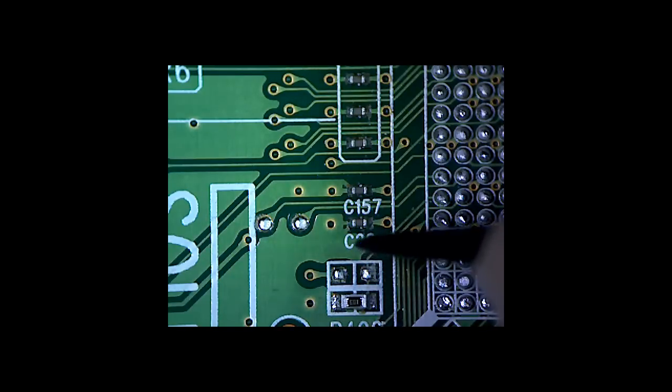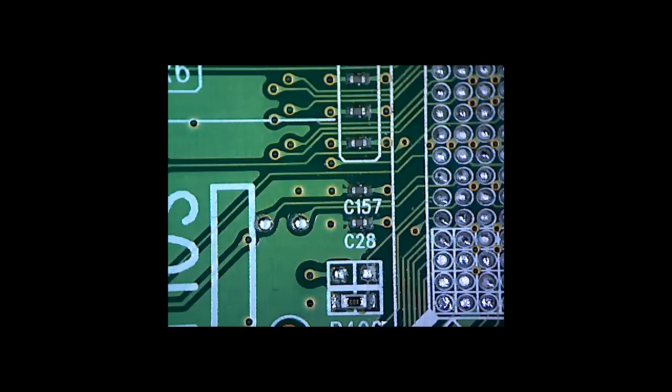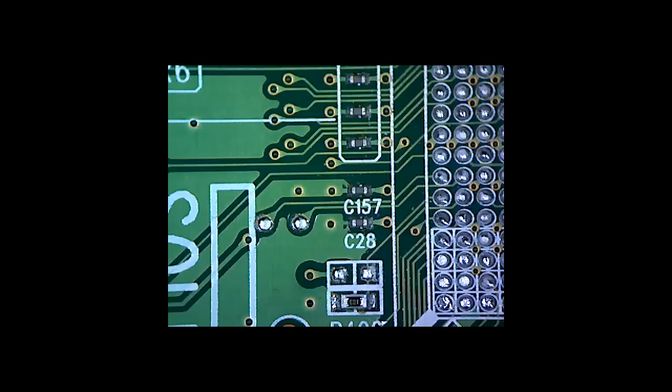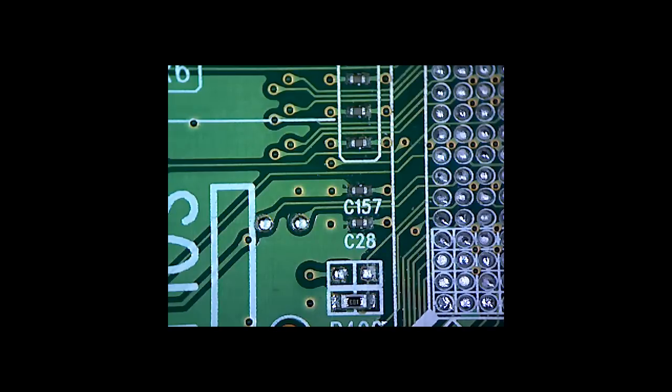The other thing to bear in mind is the image quality is very much dependent on your PC or laptop. The slower the performance, the lower the resolution that you'll capture at a reasonable frame rate. You can enlarge this to full screen but it's just all blocky and horrible if you do that, so don't even bother. When you click on the maximize and restore down button, top right next to the little white cross, it will automatically go down to the size of box that gives you a decent image quality. You can click and drag that box out, but you'll find on lower end computers the image will instantly become out of focus and pixelated.